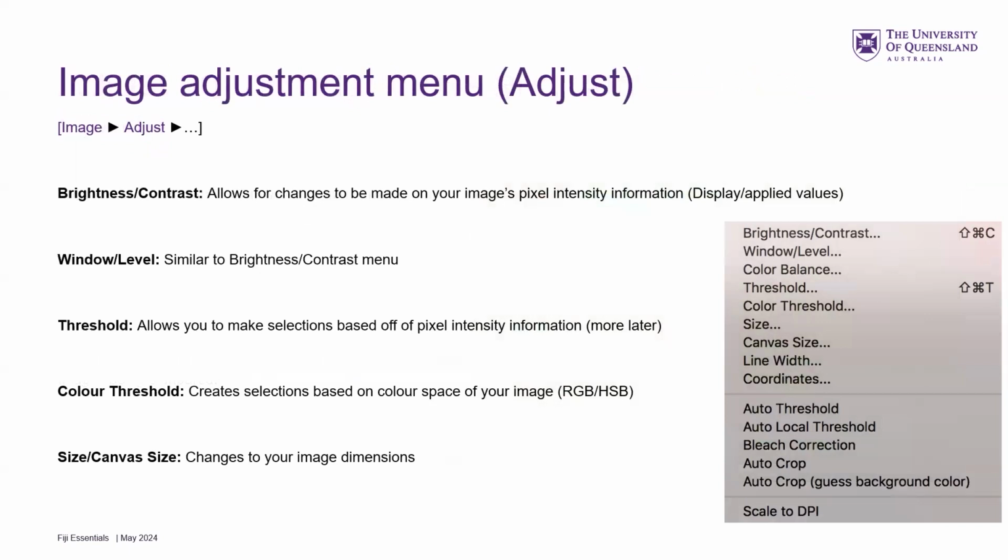So there's a number of different ways in FIJI that you can adjust the display settings. It's under the image adjust. Nice and helpful. The main one that most people probably use is the brightness and contrast. And that allows you to change the way it's displayed on the screen and therefore on your talks and publications and things like that. There's also the window level that's similar, makes it brighter or dimmer. And then you also have some other menus that we'll cover, at least thresholding later. I don't cover color thresholding anymore. And you can change like the canvas size if you need to adjust it, make it bigger.